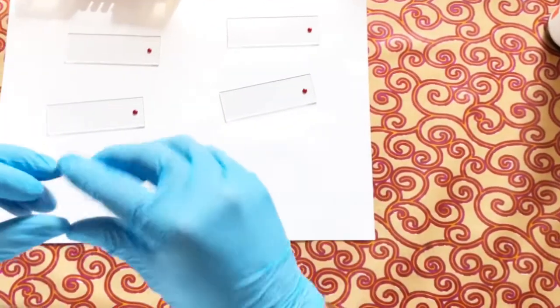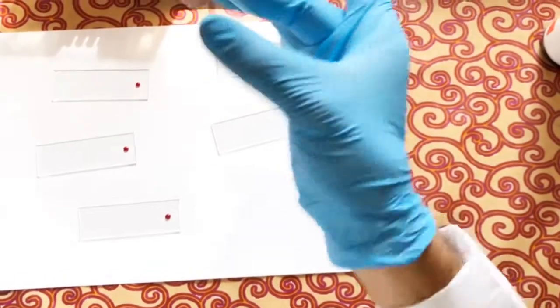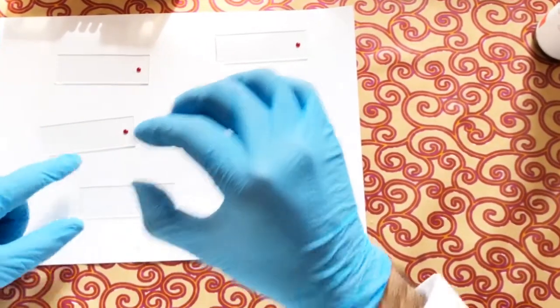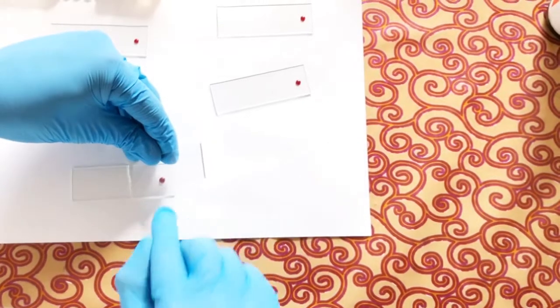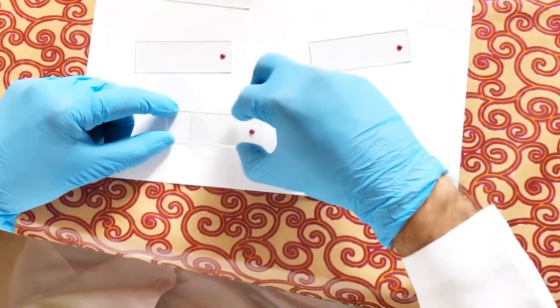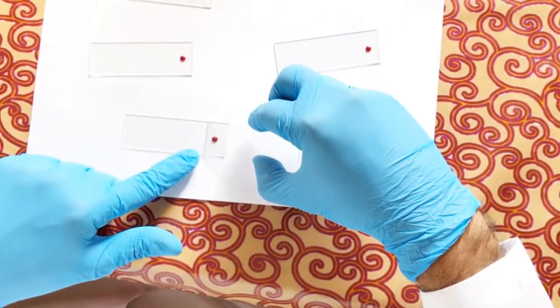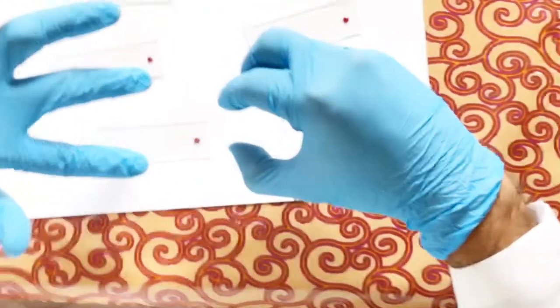Hold the spreader using your middle finger and thumb, or the index finger — not like this, not in this incorrect grip. Do not apply too much pressure. The angle is key: the spreader should be at approximately 30 degrees to the slide. Once you have the 30-degree angle, move the spreader back to touch the blood drop; when the blood touches the spreader edge you will see it spread across the bottom.